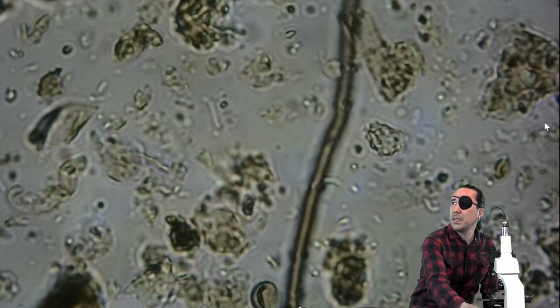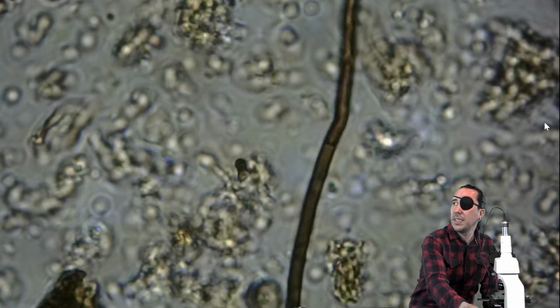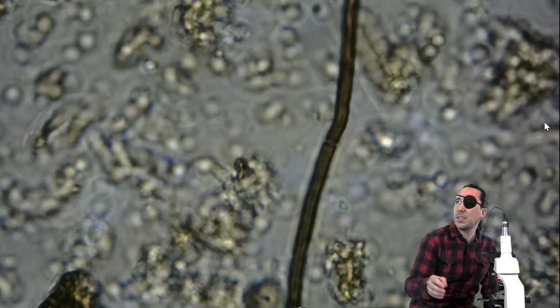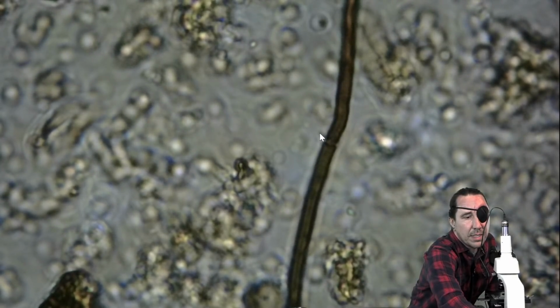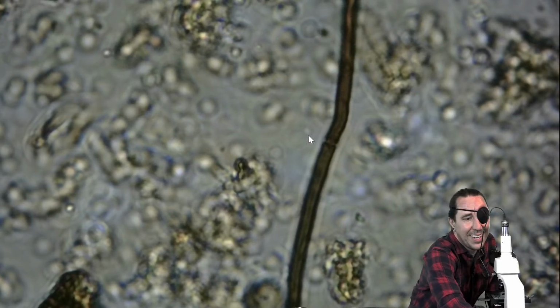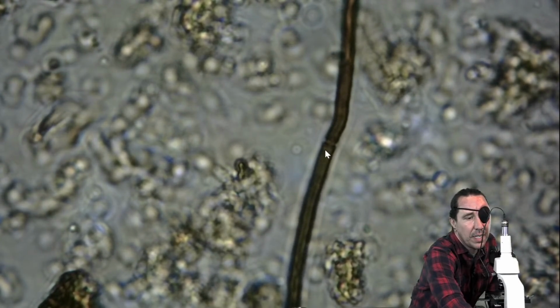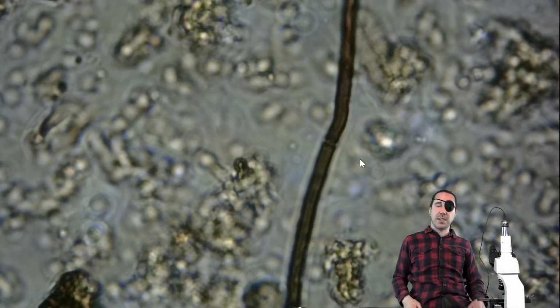So if we were to look at the width of this one, trying to get it into better focus here for you. It's hard to see a bacterium right next to it. They keep moving. There's a little dot right here that you may not be able to see, but I'm going to count that as maybe 1, 2, 3, 4, 5, 6 micrometers wide, again, similar to the last one.